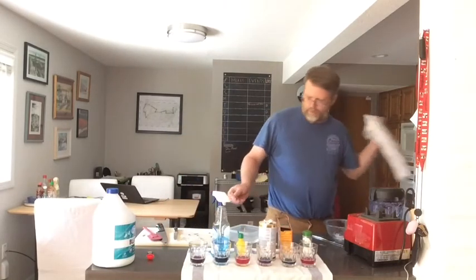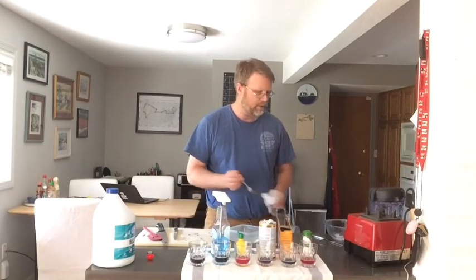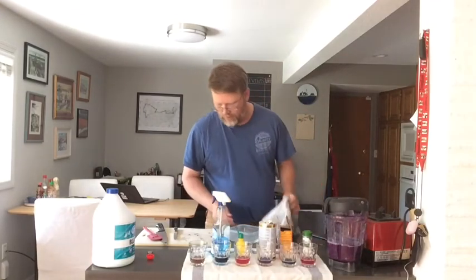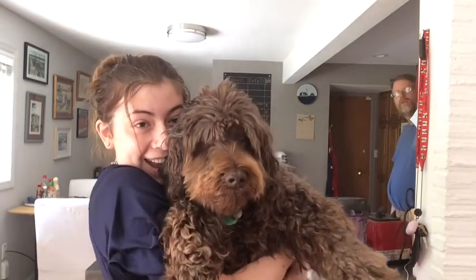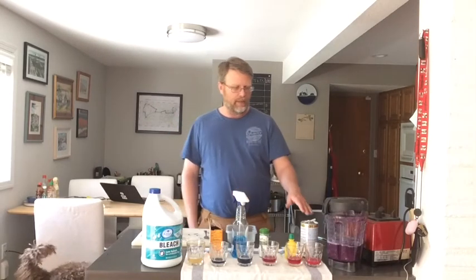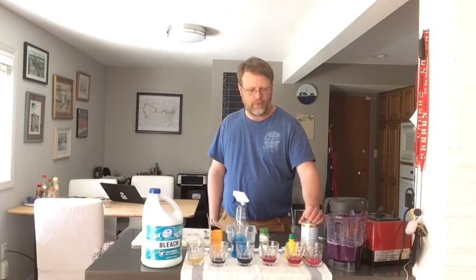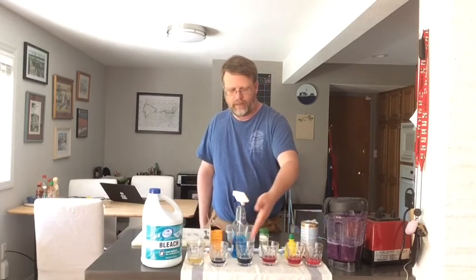Now we can see the solutions have taken on very different colors. We gave it a little time and sorted them all out by pH. The Bar Keepers cleaner did take on more pH — we added a little more solution to it because the label said acidic. This shows the range from the most acidic to the most basic by color. And with that, thank you for coming.